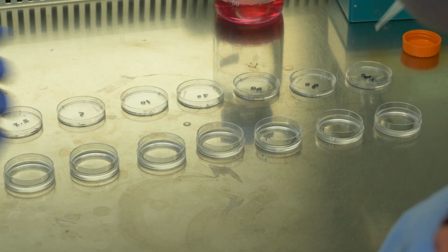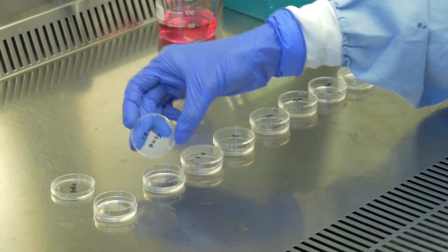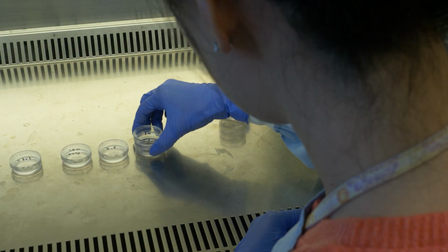Thank you JJ for making our beautiful samples. Okay, now I think our samples are almost ready to investigate the ability of carbon quantum dots for intracellular ferric ion sensing. But let me ask a question first.